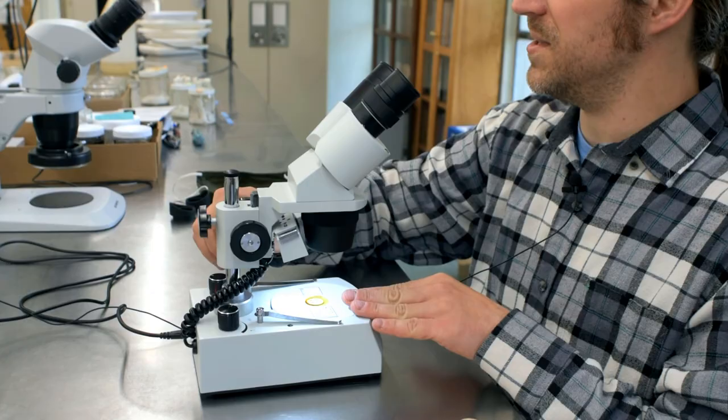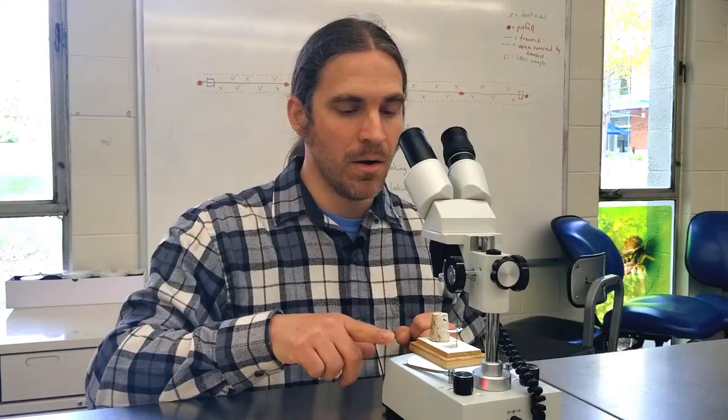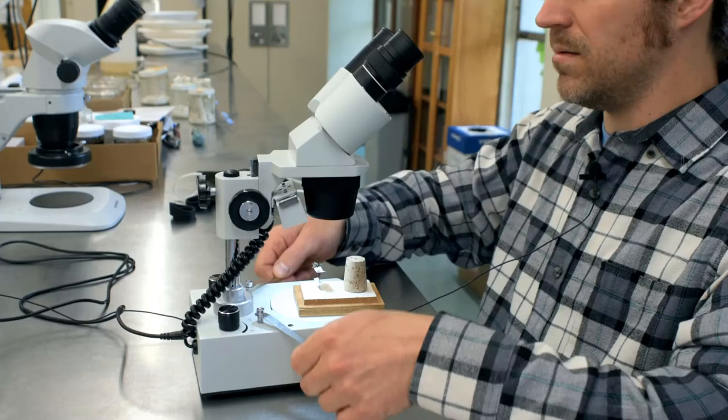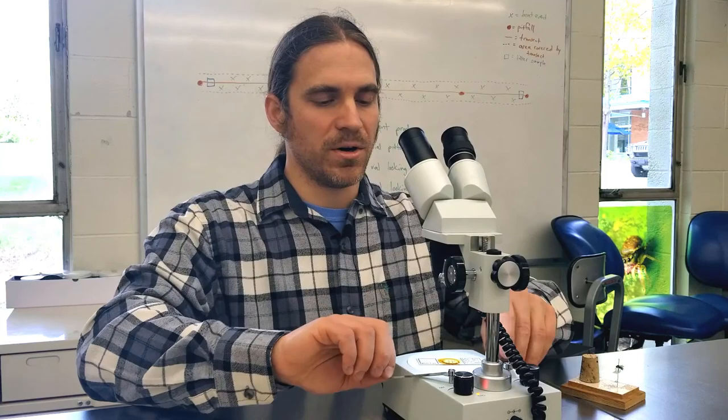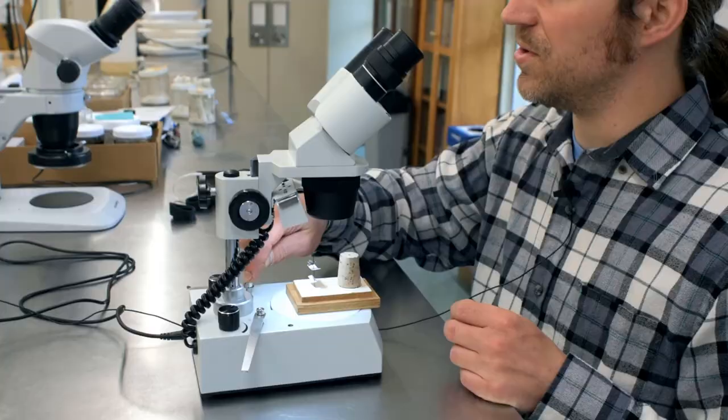One aspect of this microscope are these little pieces of spring steel. These are used to hold things like microscope slides in place. If you are looking at an insect on a stage, these generally just get in the way, so you can move them out of the way if needed. This particular scope also has screws here, so if you need to remove them completely, you can do that as well.